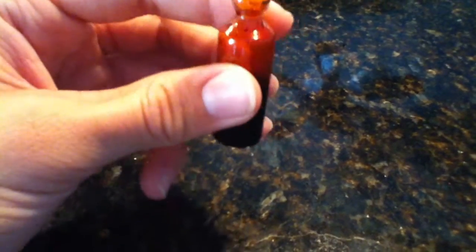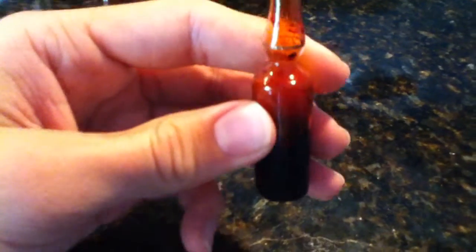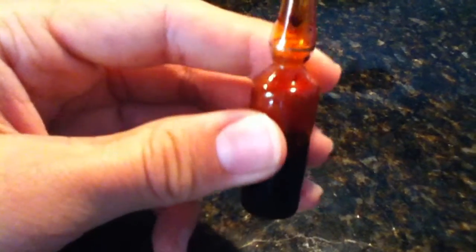I used a lot more sodium bromide and I've got it in ampoules here so I can just play with it. You can see this ampoule here — it's about half full because we had one mishap with an ampoule and we had to re-pour it and I lost some bromine. I did have two ampoules full of it, which is about 40 grams. I thought that was a pretty high yield.